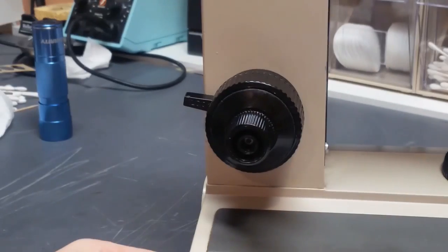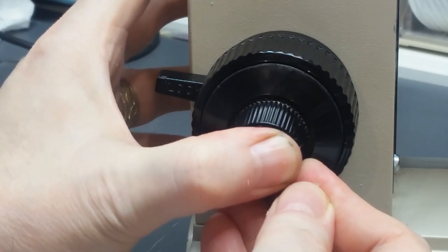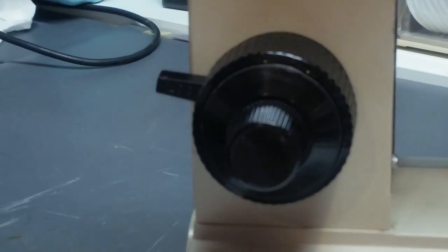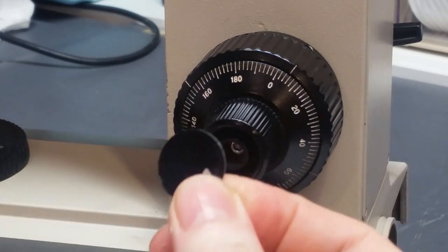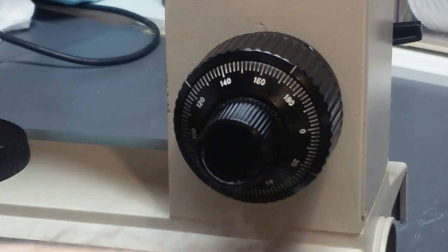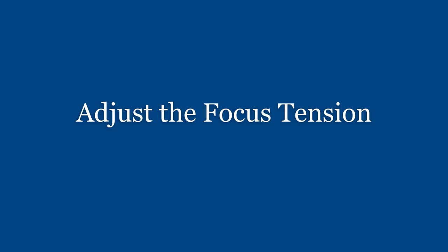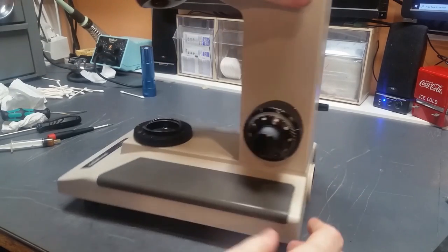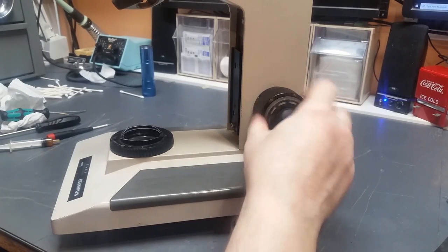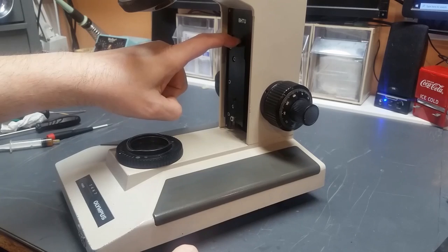Take the first one. Put it in place. Press her down. She's good to go. Spin it around. Take the second disc. Press it in place. And those caps are on there. Now, over here on the right-hand focus knob, right now, if I turn this, it's very easy to turn. In fact, it's too easy to turn. And what that means is that when the stage goes on there and adds weight, it's going to backdrive it like that. Totally don't want that.